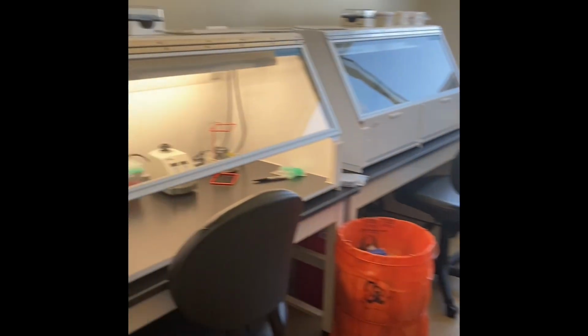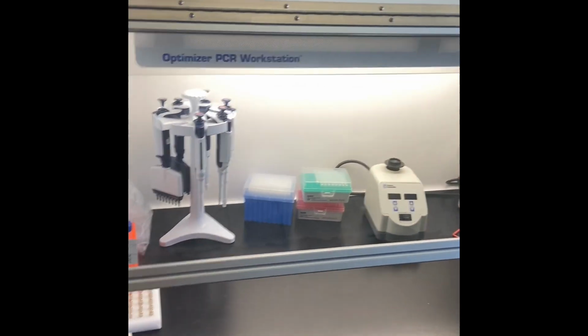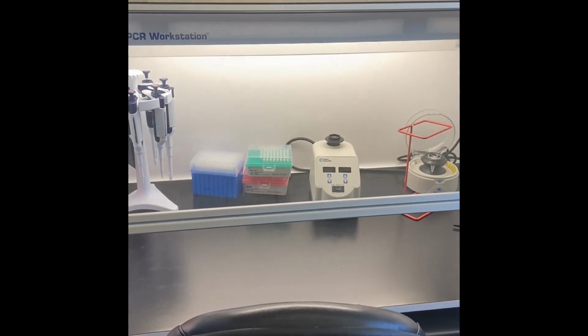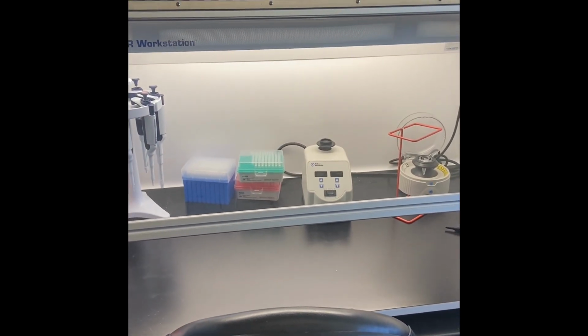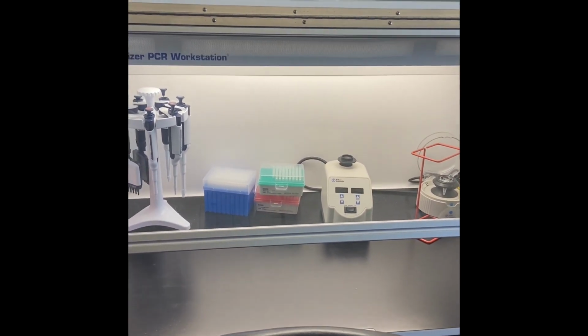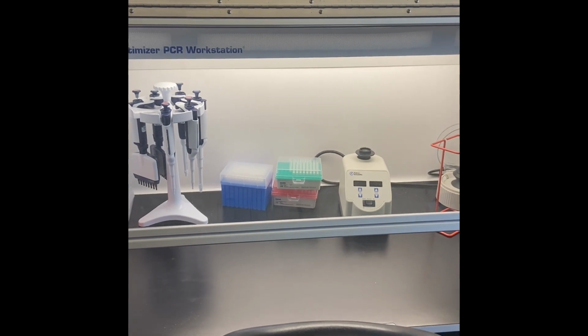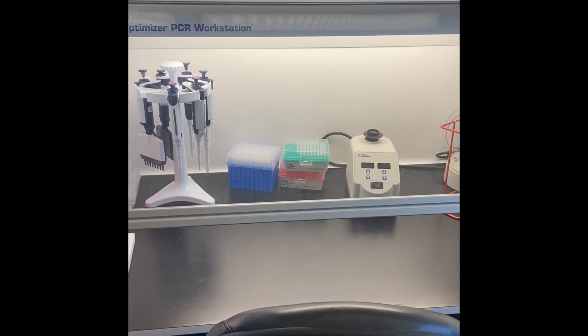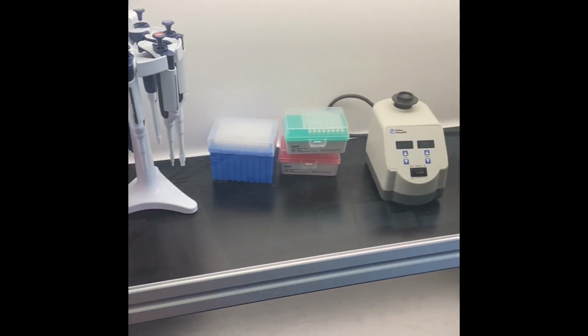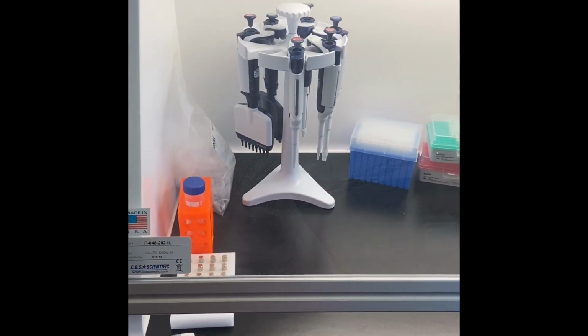We have two rooms that we do most of the library prep and assembly for our whole genome sequencing. In these rooms, we have dead air cabinets like this one featured. The other rooms have biosafety cabinets in which we have the blowers turned off, and they're used as a dead air cabinet to keep amplicon for the different steps of our library preparation separate. And you can see we have tools that make our job easier, like vortexers, multi-channel pipettes.